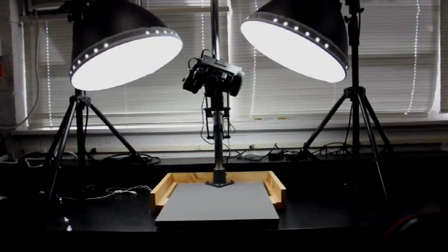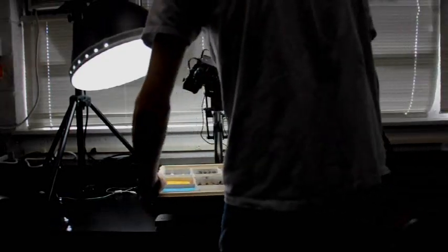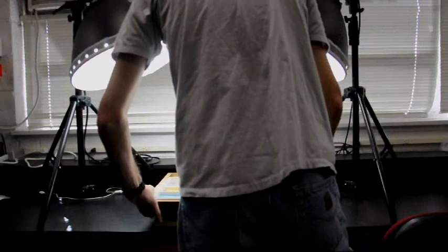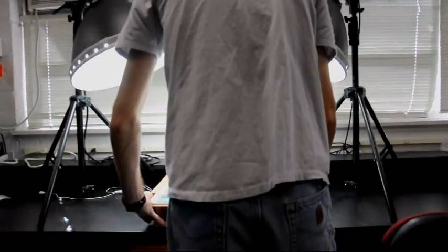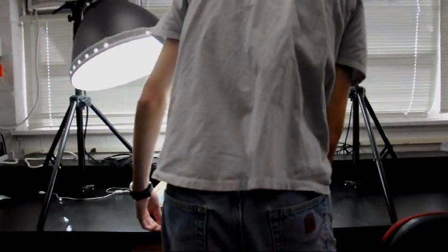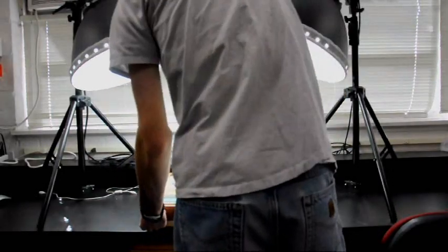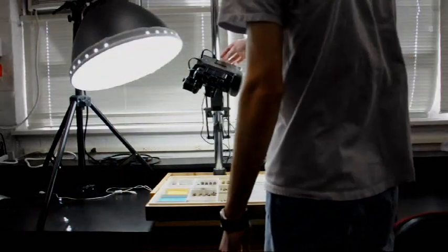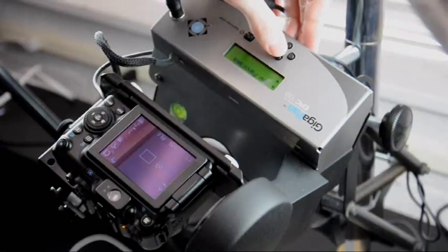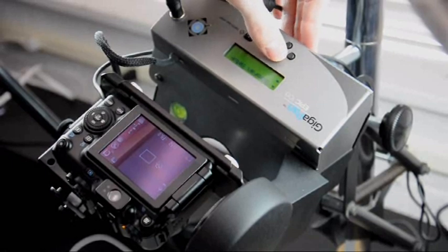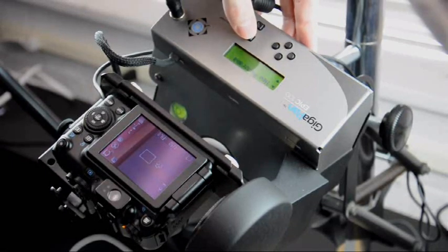So with the lights, camera, and GigaPan robot powered on, place the first drawer on the copy stand without a lid, centered, and with the top of the drawer facing away from the vertical arm of the copy stand. You can now begin to frame the panorama. This is done initially using the new panorama function on the robot.